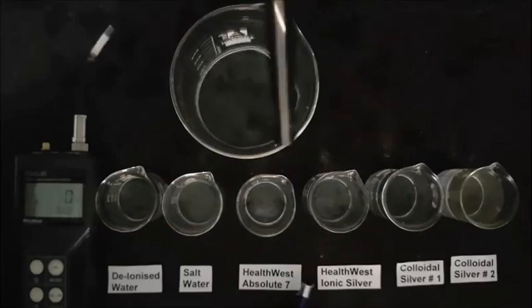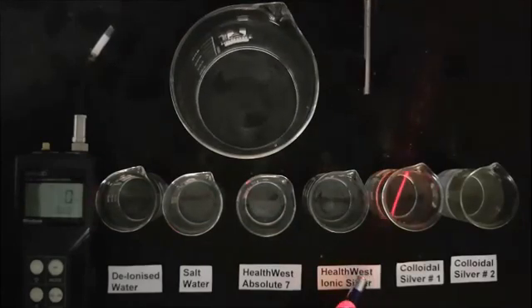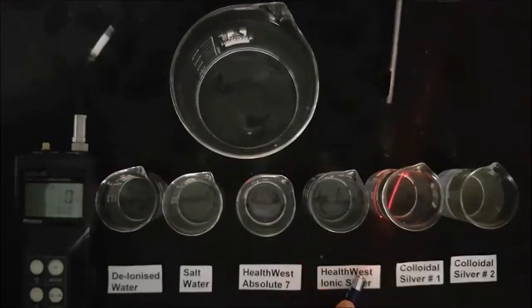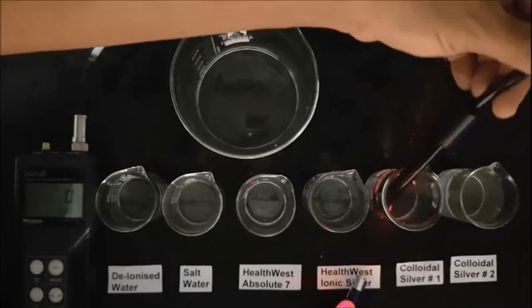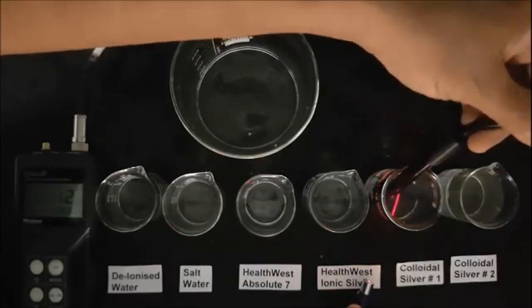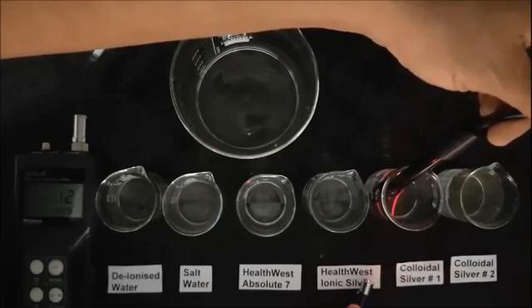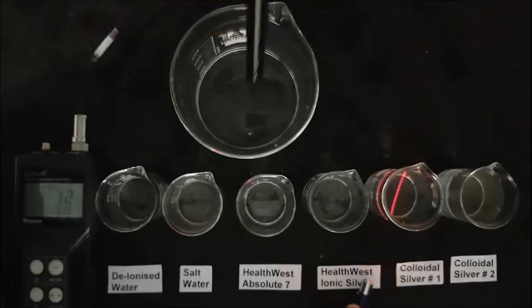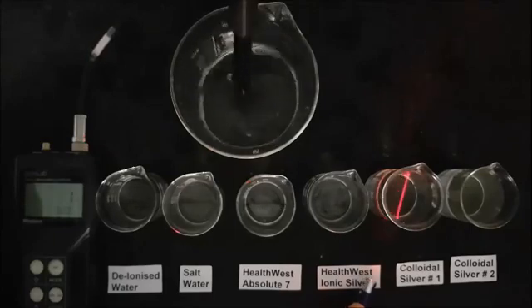As we come to the next beaker the laser beam can be clearly seen because this is colloidal silver and contains particles of silver metal. It has a concentration of 12 parts per million and the Tyndall effect is typical of what you would expect to see in these sorts of silver preparations.